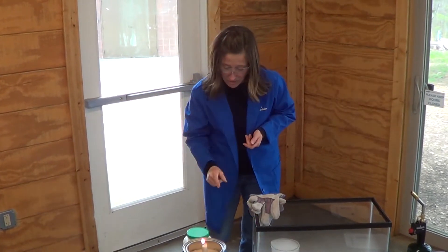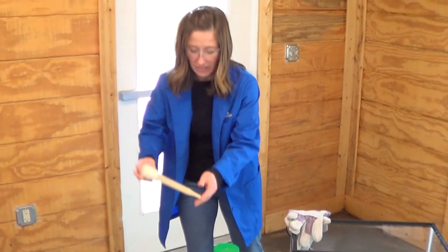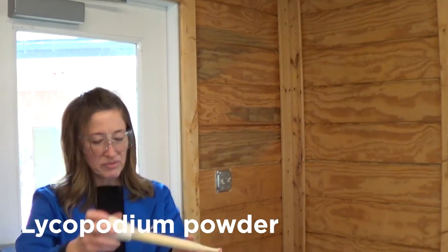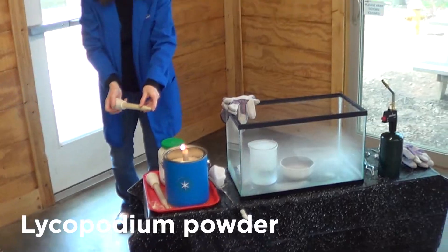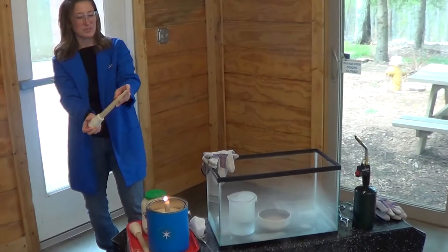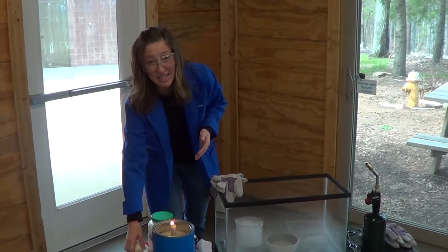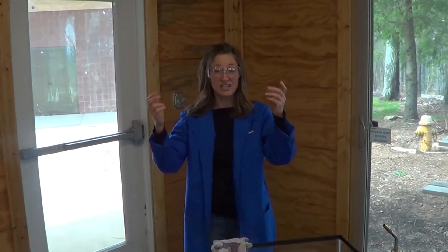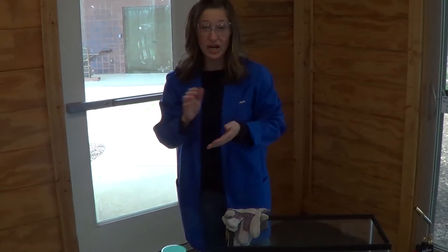What I'm going to do is take a special chemical called lycopodium powder and take it through our flame. Let's see if we observe a chemical change. We saw the production of light and I can feel the heat. I know you guys aren't in the room right now, but I can definitely smell something as well.